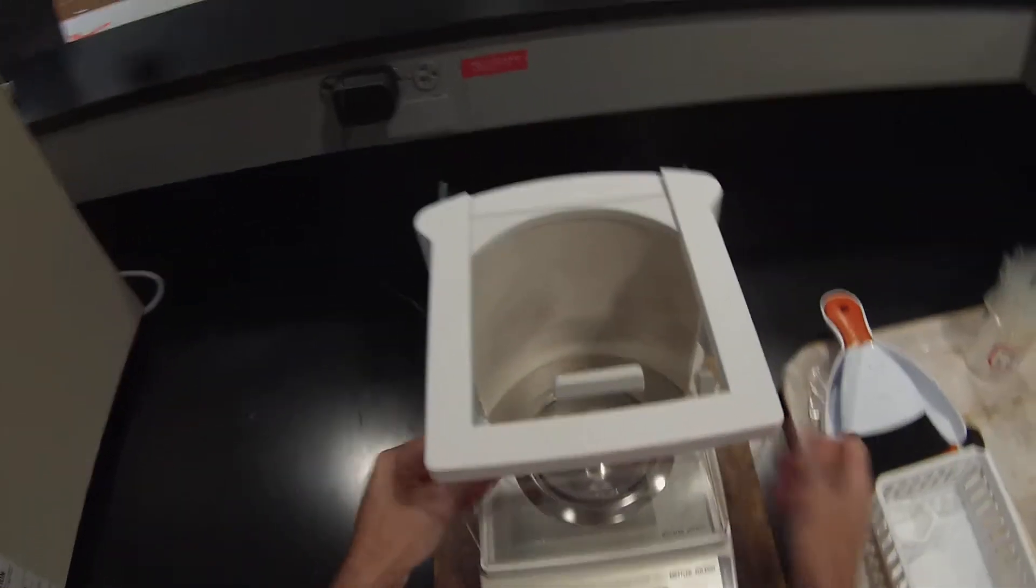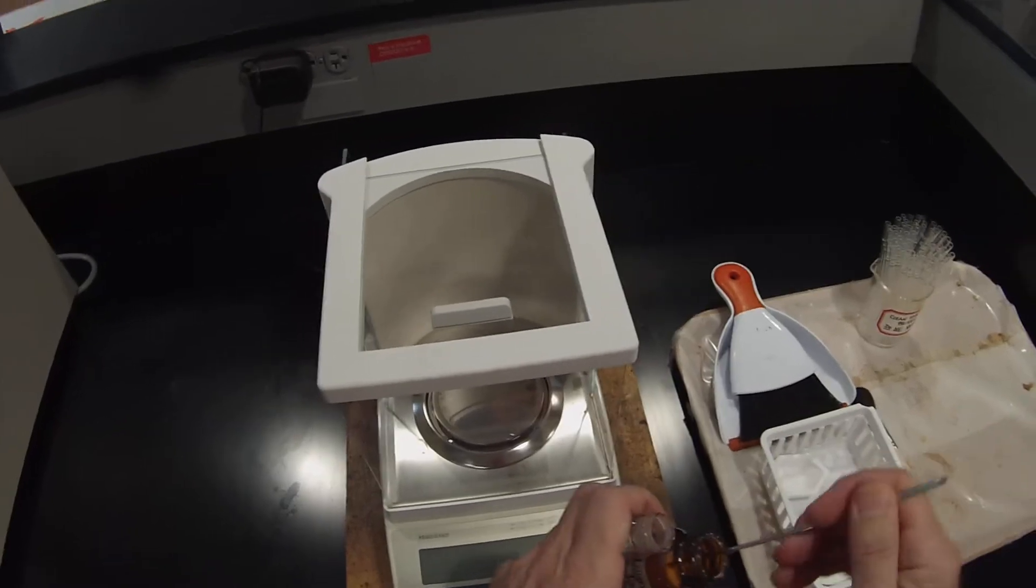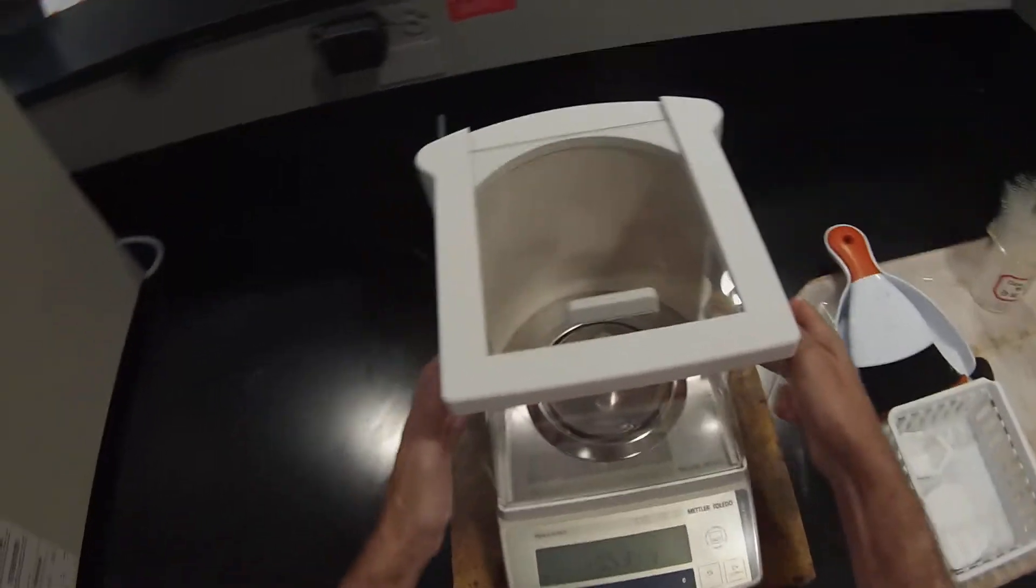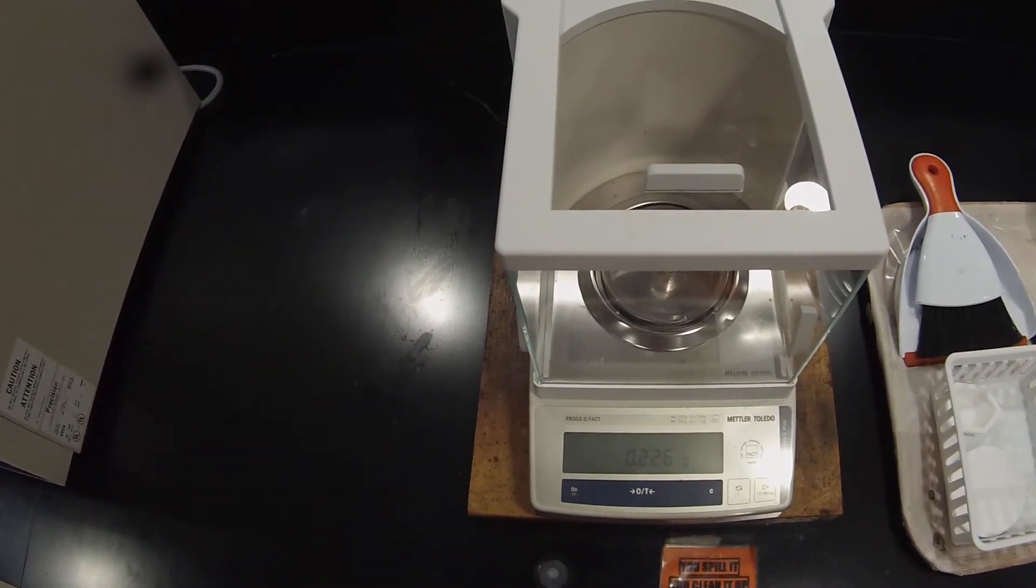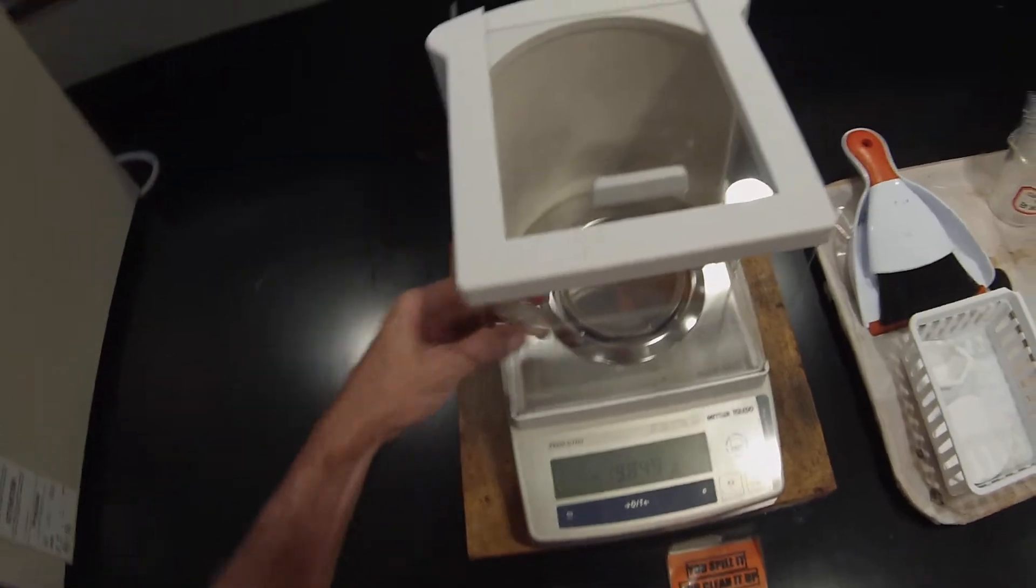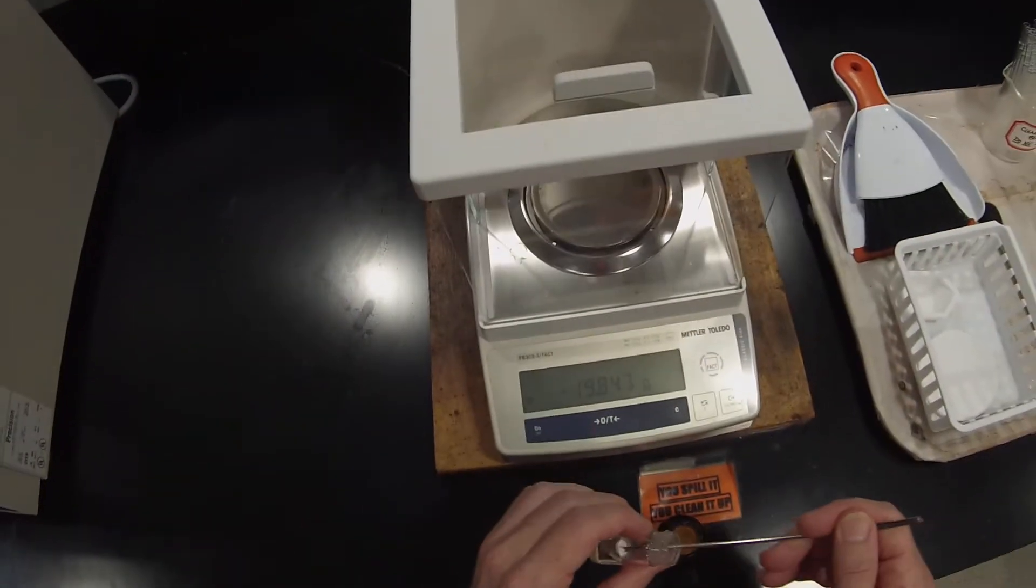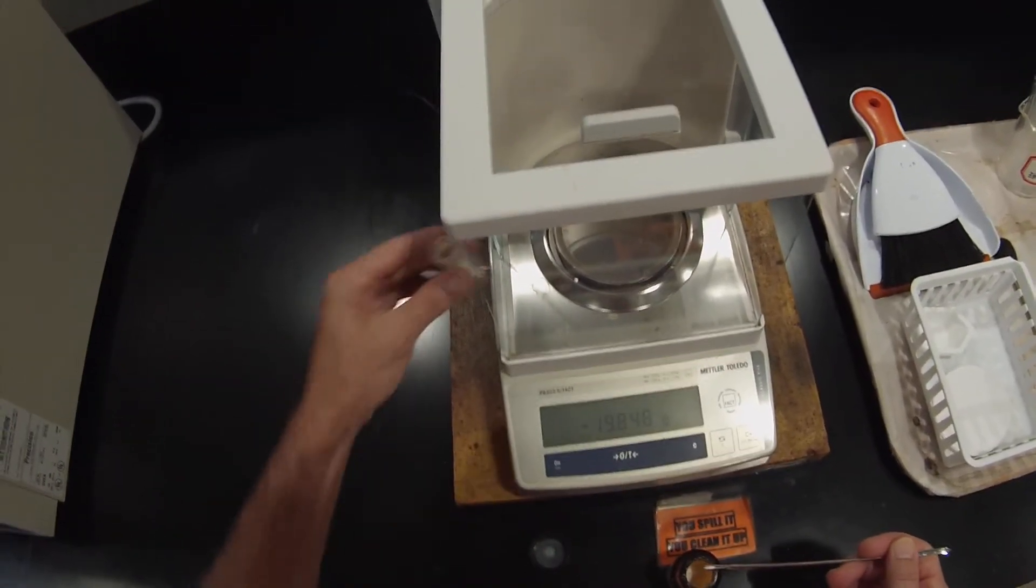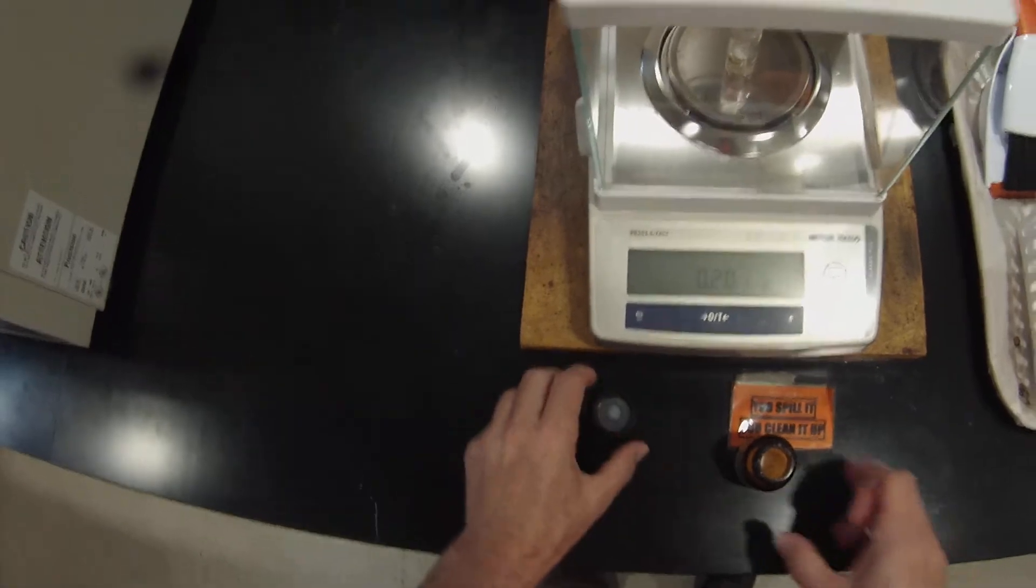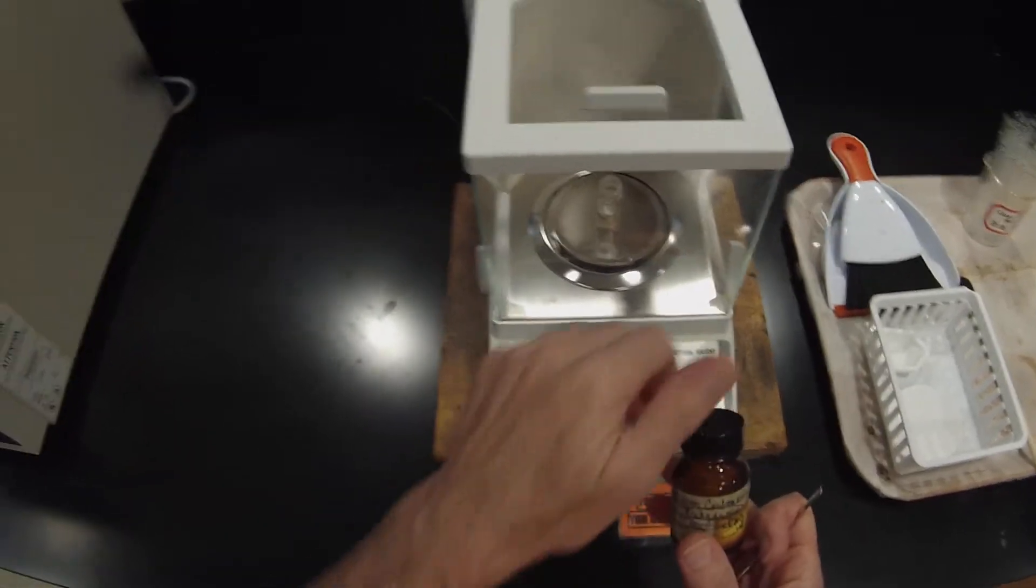And two more scoops. And 0.14, you see that the air currents in the lab have quite an effect. So that's 0.226 grams. A little more than we really wanted. 0.16. And 0.201, 0.202.